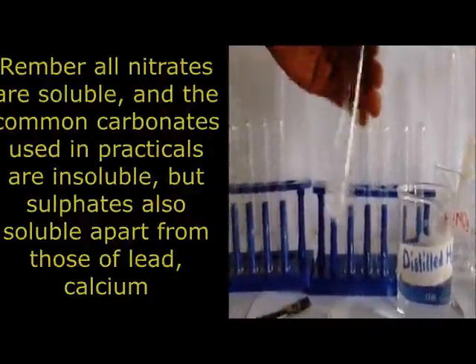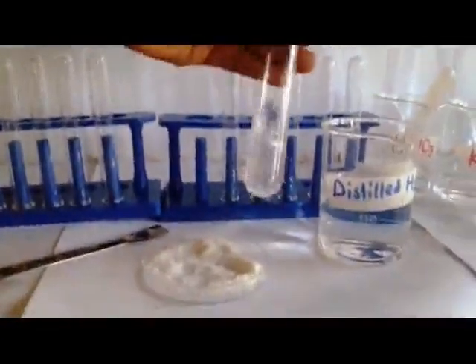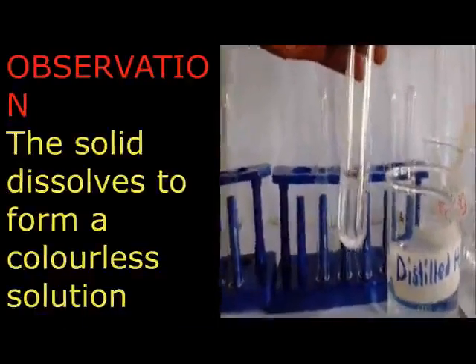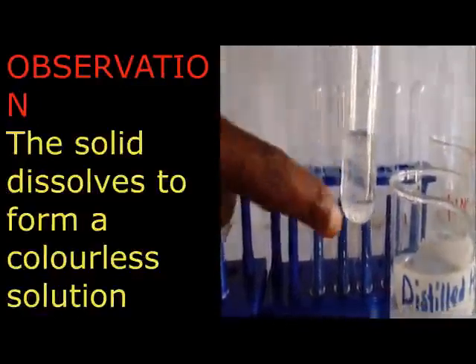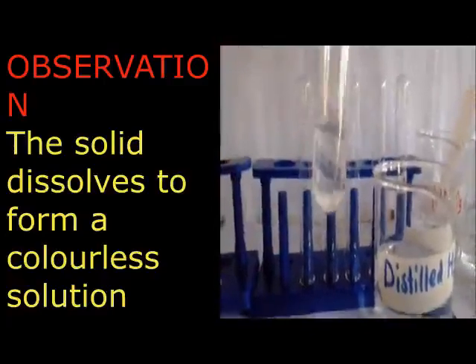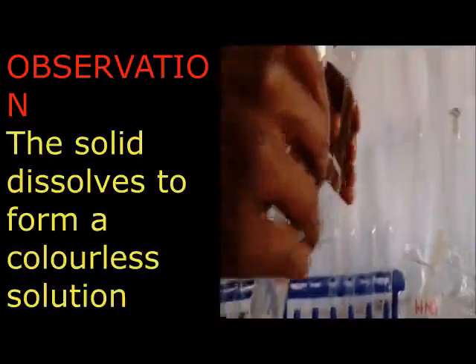As I'm shaking, I make sure that I observe whether the salt is dissolving or not dissolving. So you do thorough shaking. Don't shake for 5 seconds or 1 minute and run away. Shake thoroughly as you shake, to discover whether the salt is dissolving. Now you can see we continue shaking properly. When I'm shaking now, you can see, members, that my salt has dissolved. So the salt has dissolved completely.